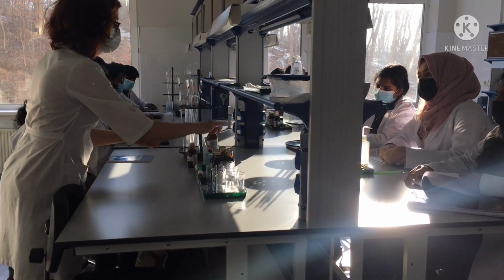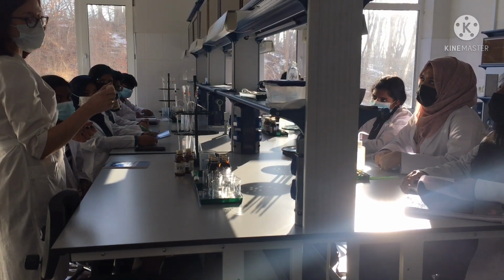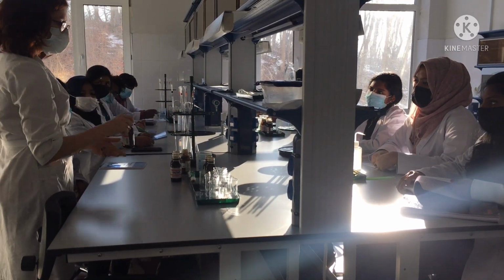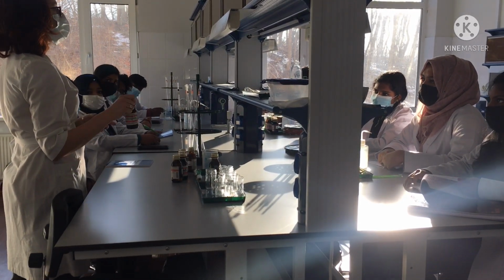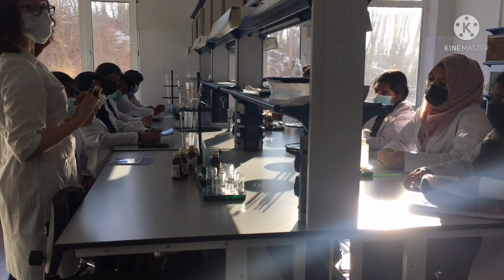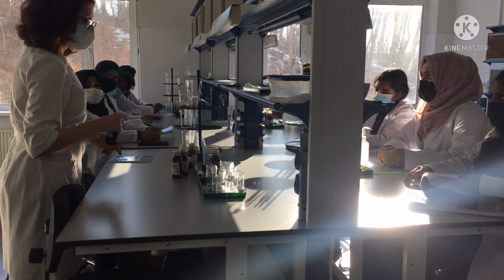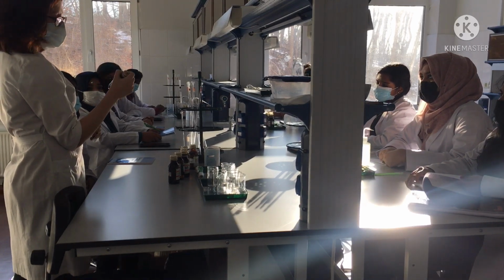Today, as you can see, we have different reagents in the bottles. So it's potassium iodide, deionized water, 0.1 molar solution of HCl, sodium thiosulfate, potassium bromate, and the solution of starch as the indicator. We have a complex of starch with the reagent in our chemical reaction, and that's why we will see the change of color, because of the colored complex. In series B, when we study the influence of the catalyst, we will use copper sulfate.